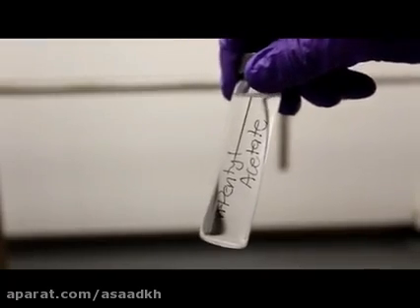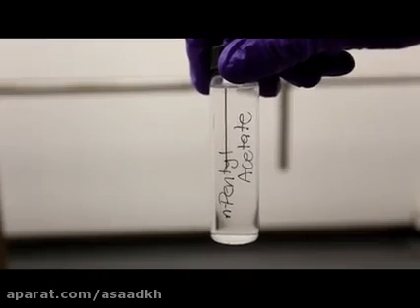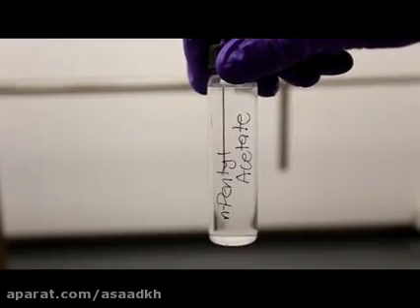The final product has a very strong candy banana odor, but remember it was made in the lab, so you should definitely not eat it or even try it.